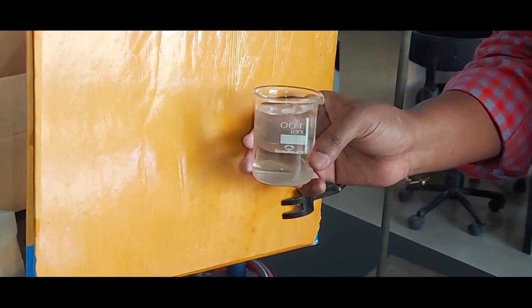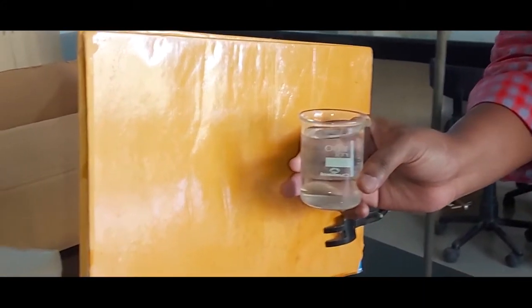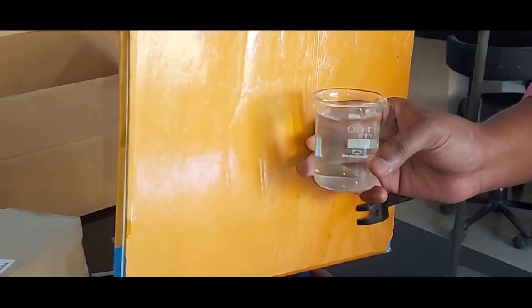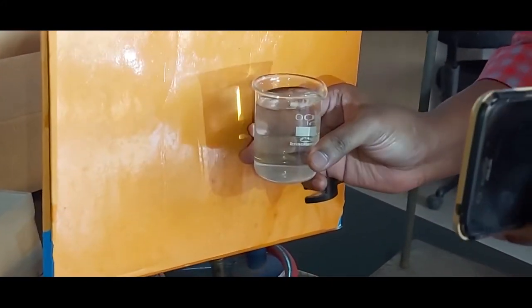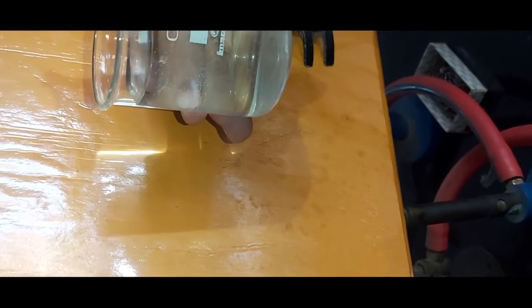Also, high iron concentrations give water a red coloration. In this experiment we will be using a brown screen and testing the water samples for clarity. For the first sample — distilled water — a source of light is passed through the beaker. When the light beam passes through the beaker, a sharp image is formed on the screen, because there are no suspended particles present in the water sample. Therefore, distilled water is the clearest water sample — no turbidity — and in inference we can say it is clear, transparent, the standard liquid.